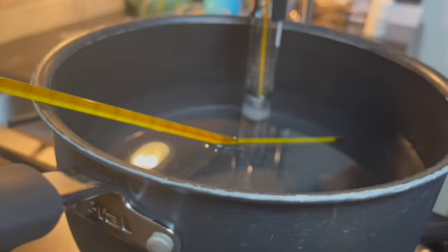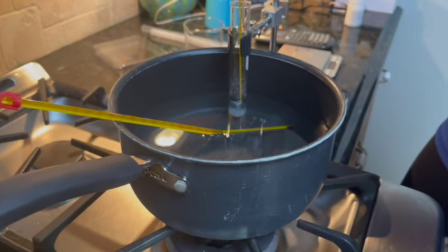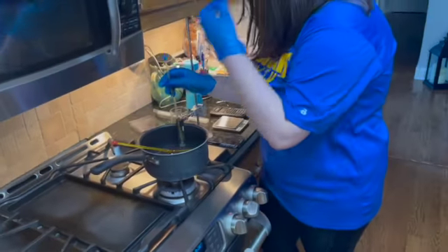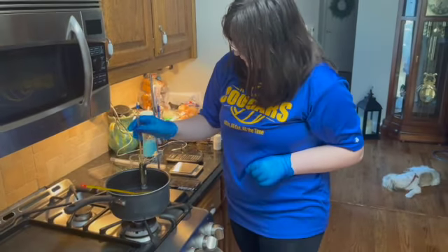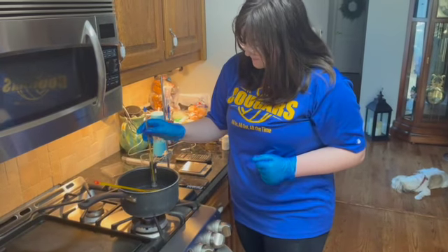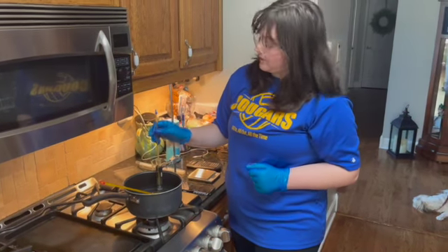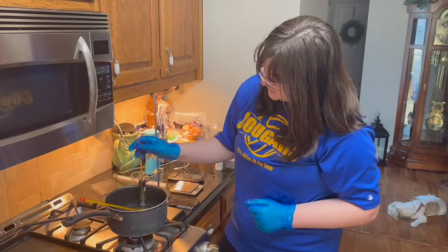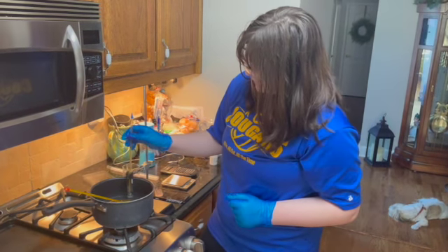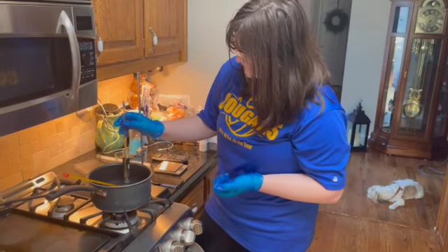Now we're at the 11-minute mark, and our solvent is at 54 degrees Celsius, and our hot bath is at 55. So we still got some time before this is completely melted. I don't really see anything different now than what I've just stated for observations during this time. But I will say that this process has gone a lot faster than I would have anticipated for this mixture.